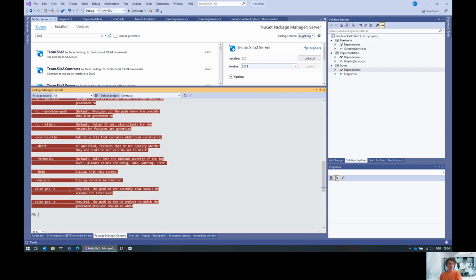And there's two things that are required. One is the path to the assembly that should be scanned for interfaces, and the other one is the path to the C# project to which the generated provider should be added. So the path to the assembly is in the contracts. We have the bin folder, and in the bin folder we have debug, net standard, contracts.dll. Then the path to the server project, which is this one here.